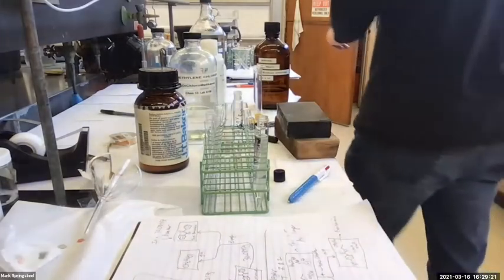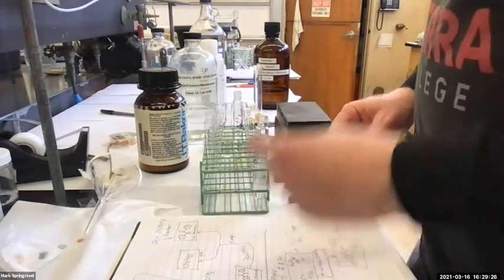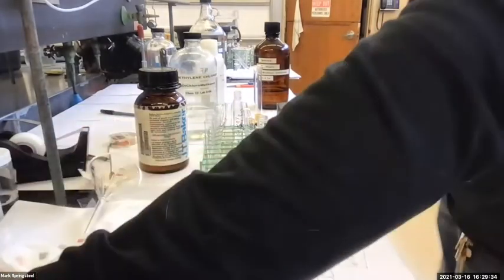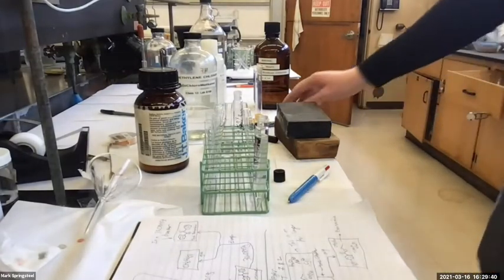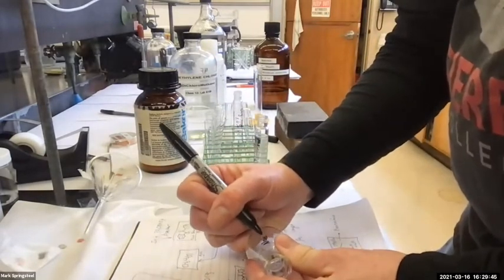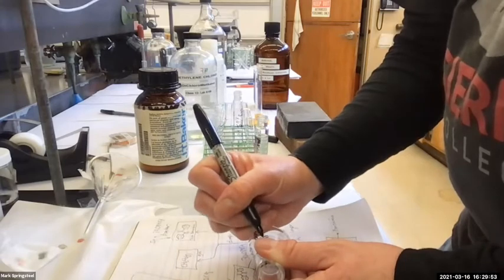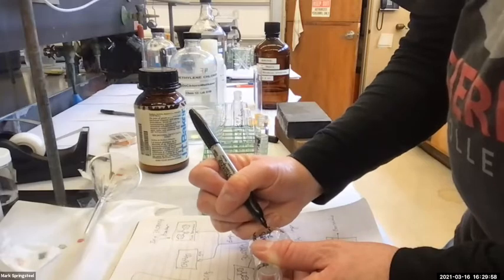And I'm gonna go into a fresh centrifuge tube, so I just could go a little bit quicker on the next step. Actually, you know what? I'm gonna not even do the brine wash this time. I'm gonna skip a brine wash. I'm gonna go right to a centrifuge, Erlenmeyer flask to do the sodium sulfate dry. So this will be my sodium sulfate, benzocaine, my name, date. Okay.